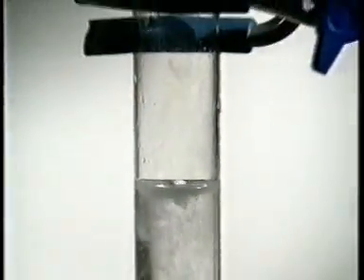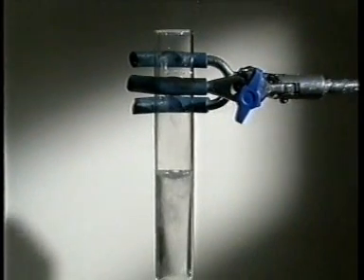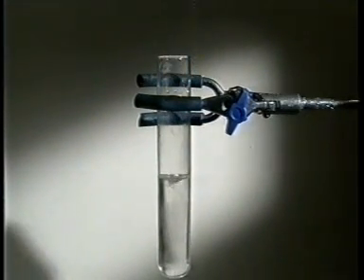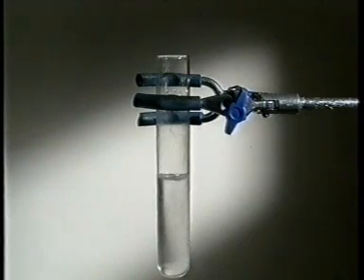By carefully putting a tiny amount into a boiling tube, the gas can be tested with a lit splint. A squeaky pop means it's hydrogen.